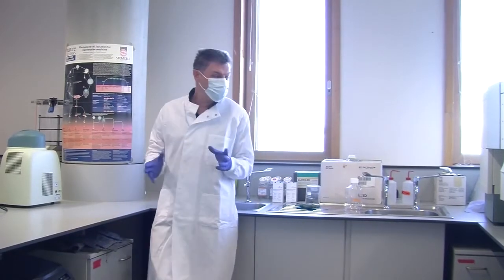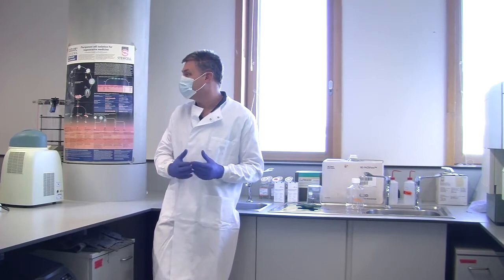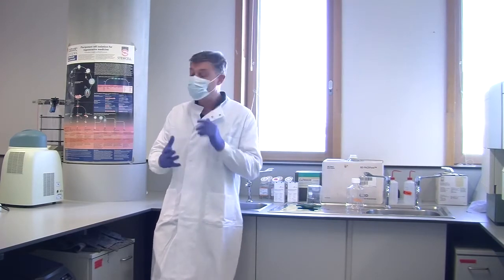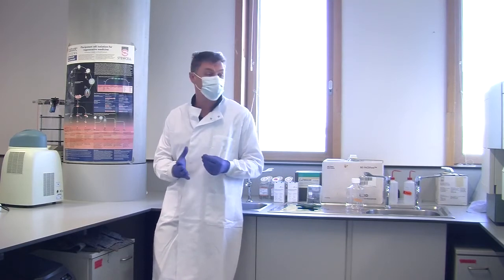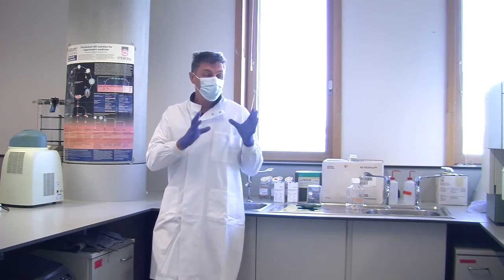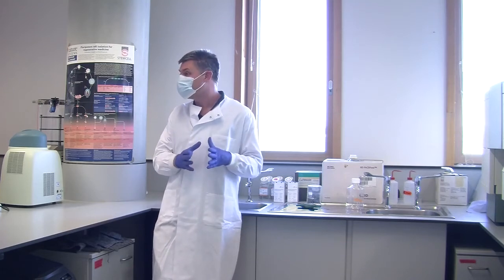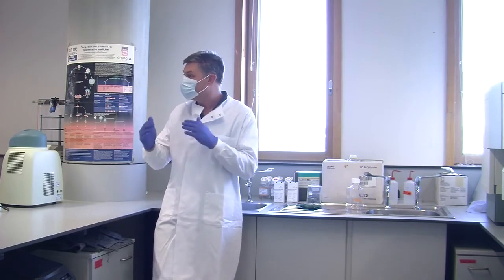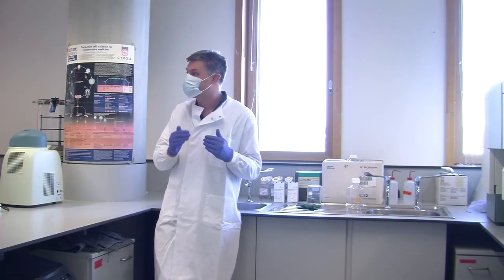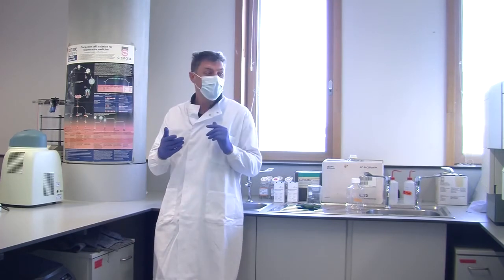Fantastic. So flow cytometry is a fairly ubiquitous technique in biological research labs and in diagnostics labs and in various other industries, so the oil industry. And what I'm going to do is go through how it works when we do the first incubation. So if we can keep it fairly synchronized, so you all put your cells on to incubate at the same time, I can then spend 25 minutes or so explaining how it works.